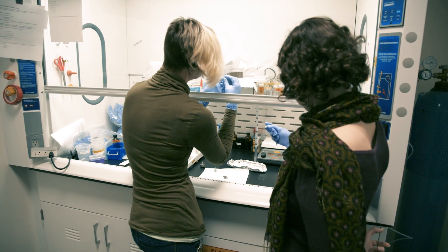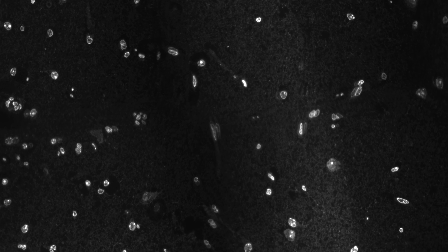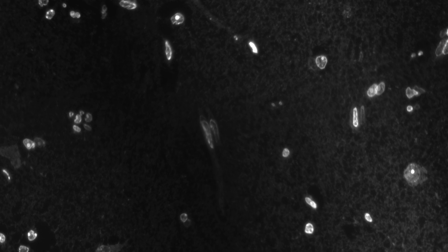When you do microscopy, regardless of how the experiments are going, every day is an opportunity to have done something a little bit better and to have a picture to show for it. There are often moments of surprise where you see something in the microscope that is unusual and you realize that no one else has ever seen it either. You see a lot of things that you learned in school don't exist — but there it is, you took a picture of it.